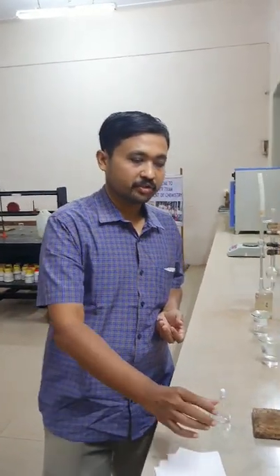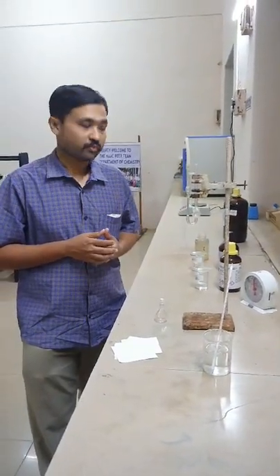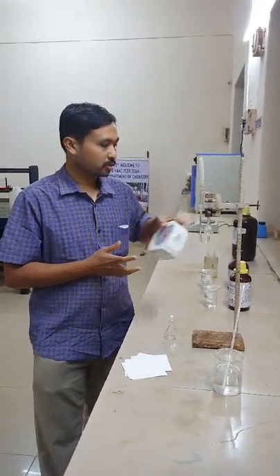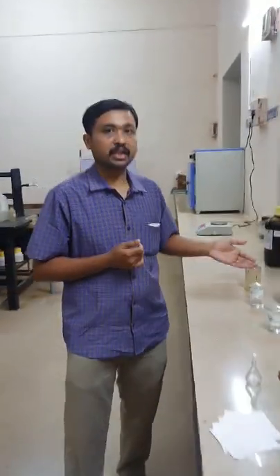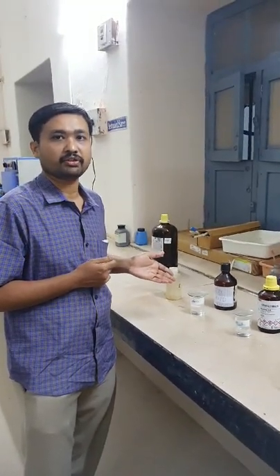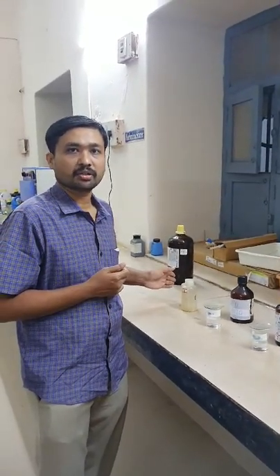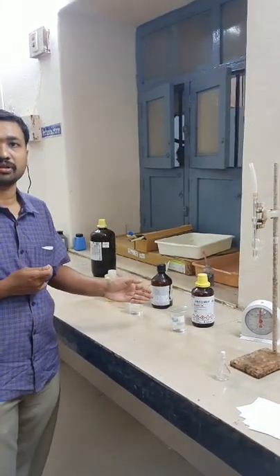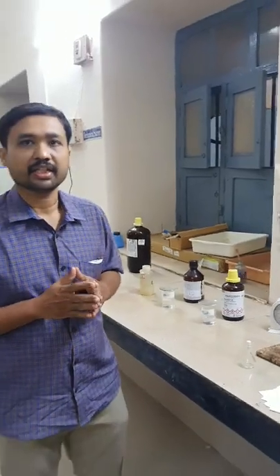We also require a thermometer to record the laboratory temperature and a stopwatch to measure the time of flow. For the solvent list, we require the unknown organic liquid of which we have to find out the coefficient of viscosity. We will also be provided with distilled water, and acetone is kept for washing and drying purposes. So let us now demonstrate the experiment.